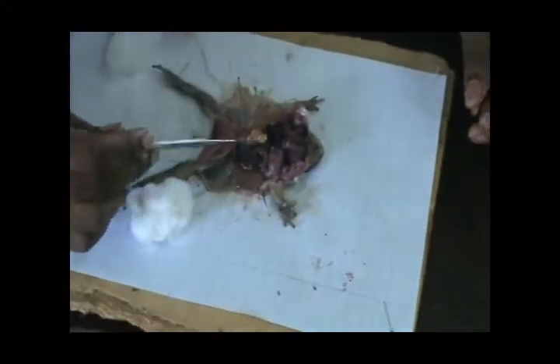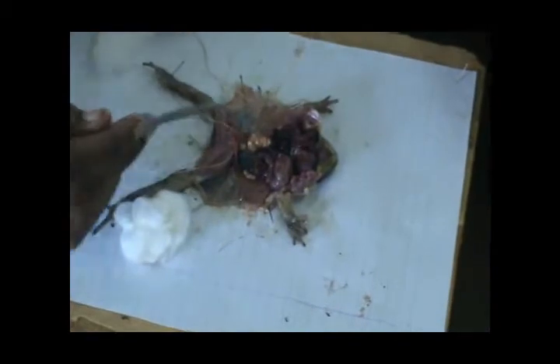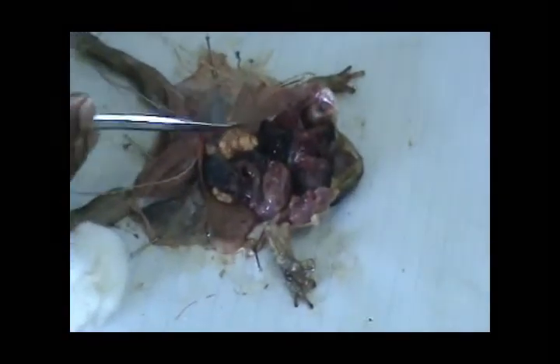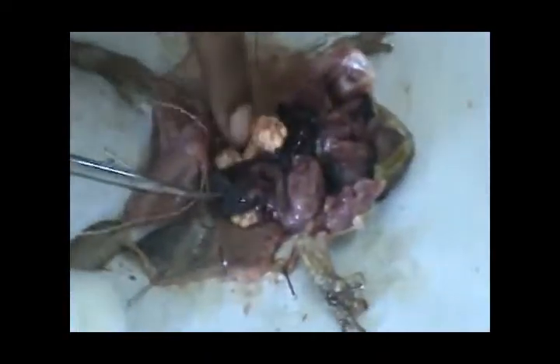On top, it will also supply ovarian veins to the ovaries, then move down.